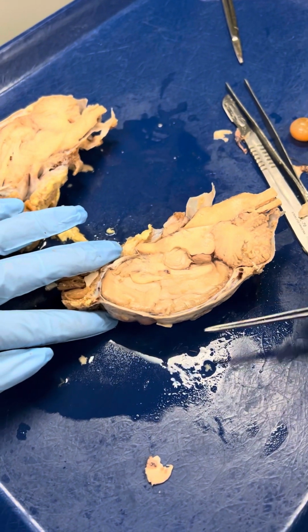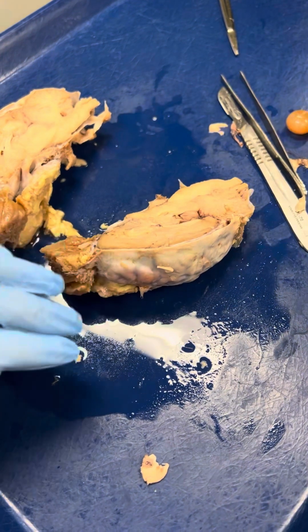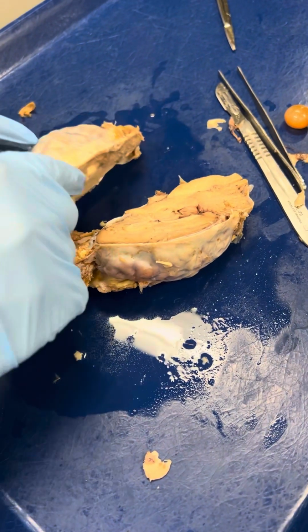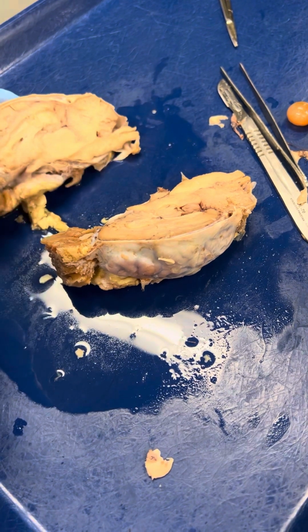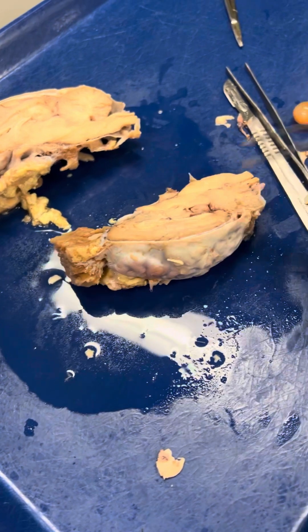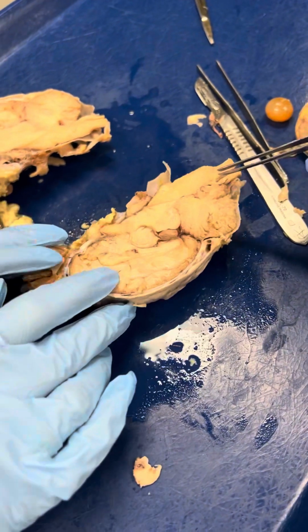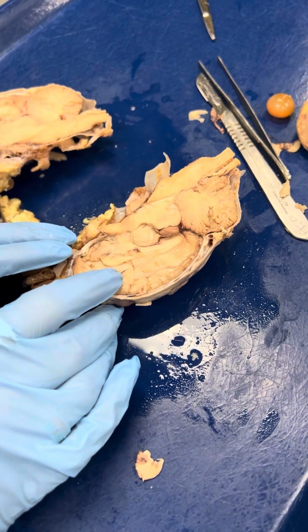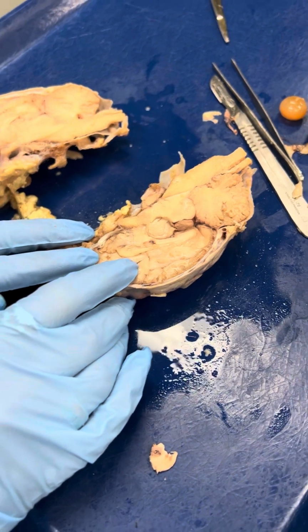The two largest are inside the left and the right hemispheres of the brain, but you would have to cut them like this to see them. They're probably collapsed. It's probably not much of a space to see. But this is the third ventricle. A fourth ventricle is located down in this area, but it's hard to see because it's kind of linked with the central canal. I'm not worried about it. It's for the anatomy part.